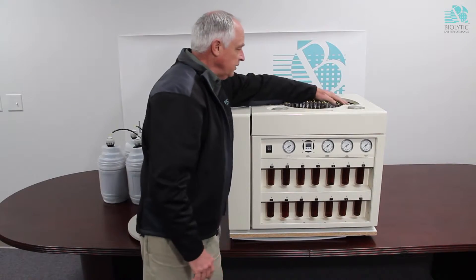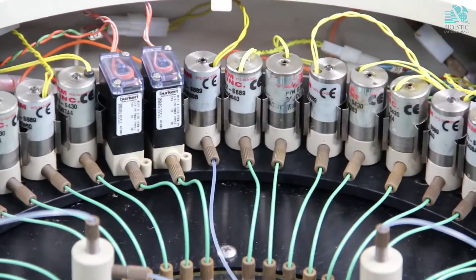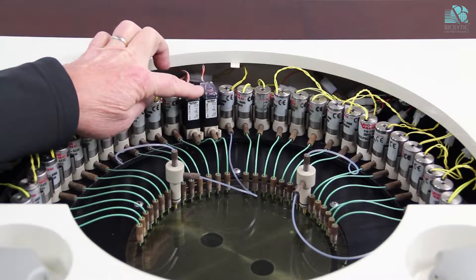On here we'll see that we put in what we call the valve turnover kit. We put in this valve which is a little bit taller. This is a different design than the original.